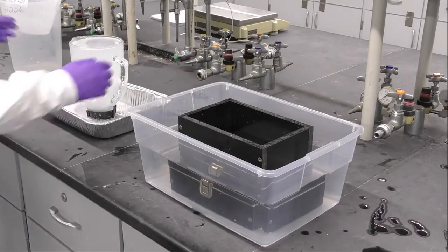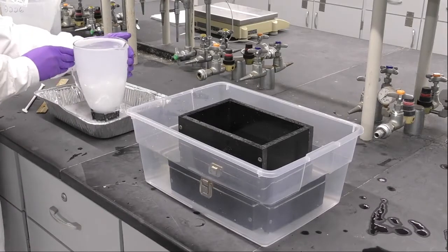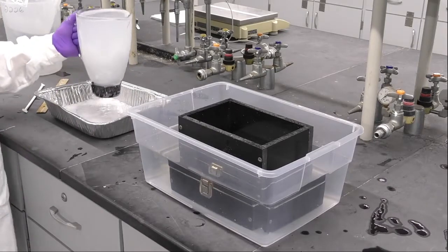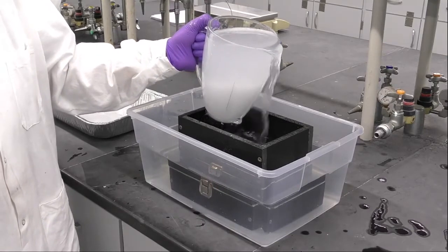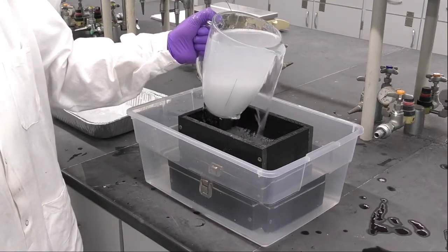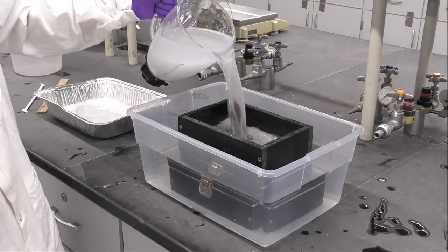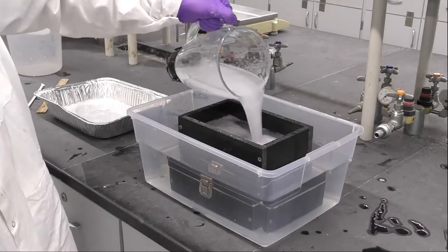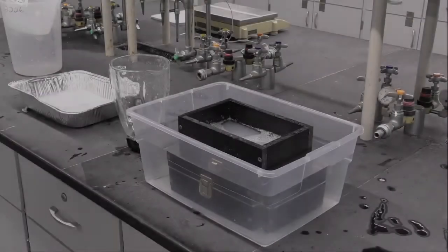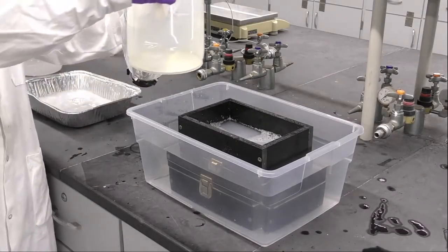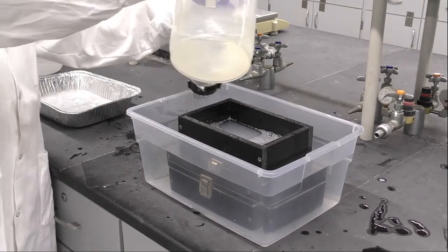Now that we are sure that we have the correct level, we carefully pour our water with our fibers into the mold. Try to not spill the mixture outside of the mold. You could re-rinse the blender and make sure that no fiber is left behind. Put everything in the mold.